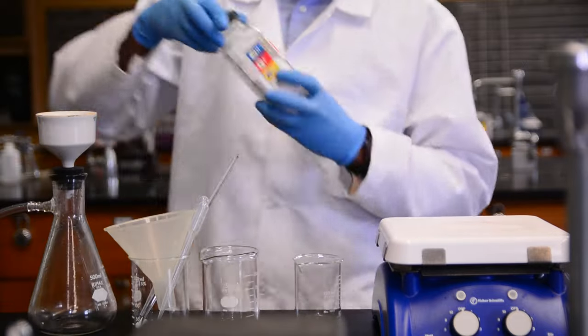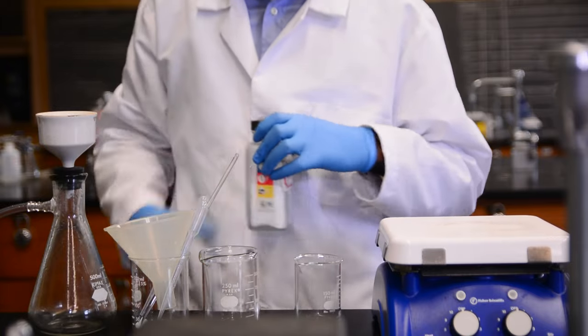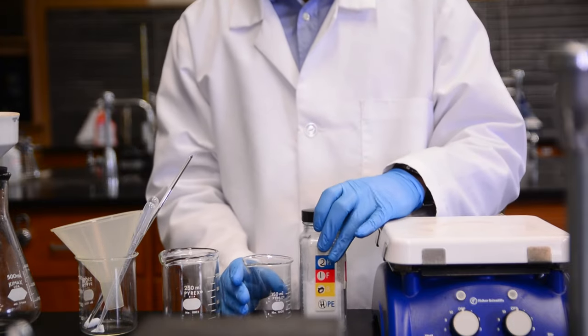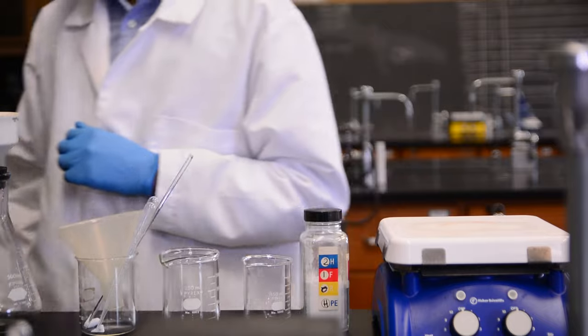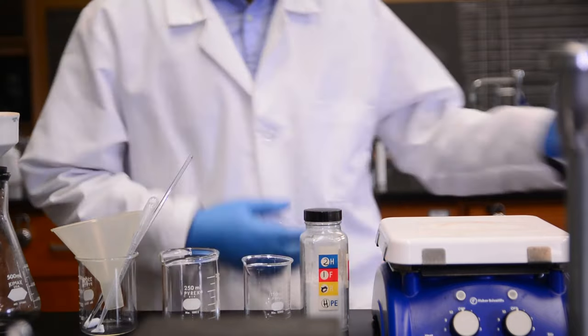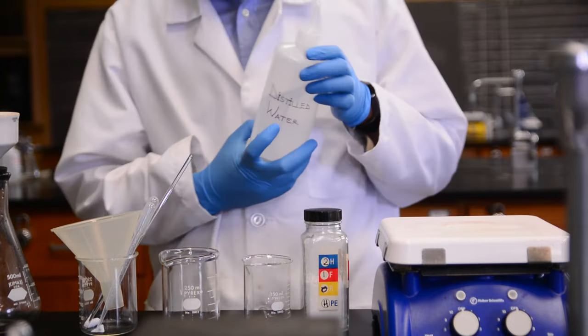Lastly, we're going to need our product. Remember, this is a technique that is typically applied in order to purify a solid product that has been collected at the end of a chemical reaction. In this case, we're going to use impure benzoic acid, as though we are continuing the extraction we performed earlier in the series. And for the solvent, we will use distilled water.